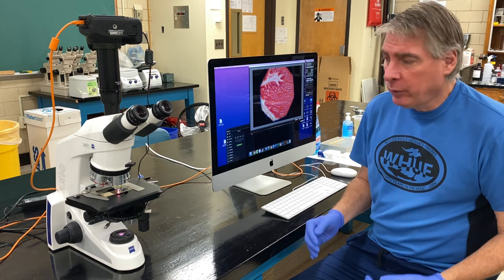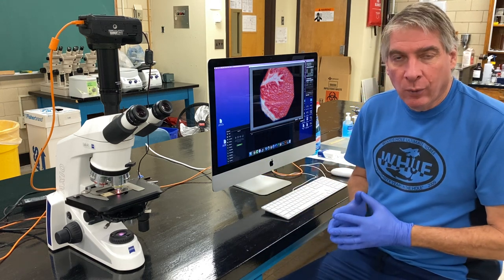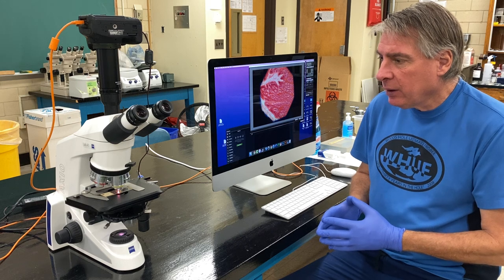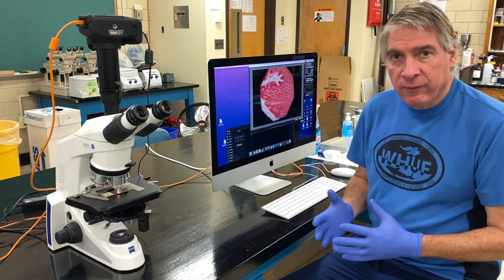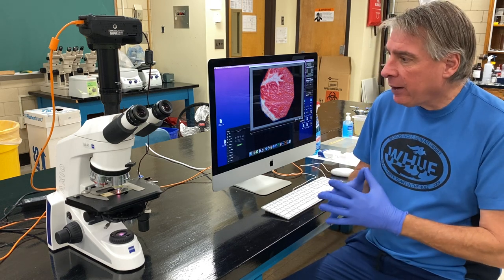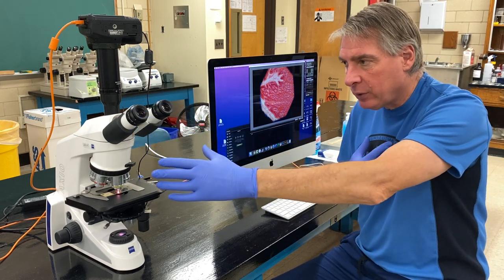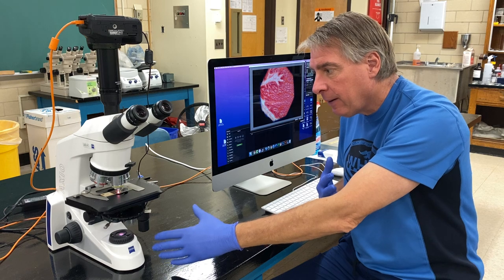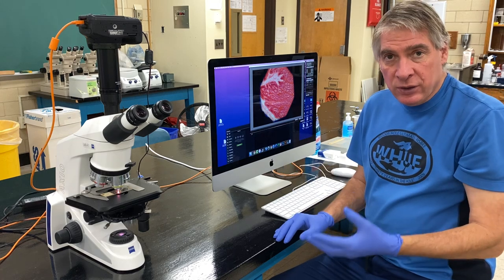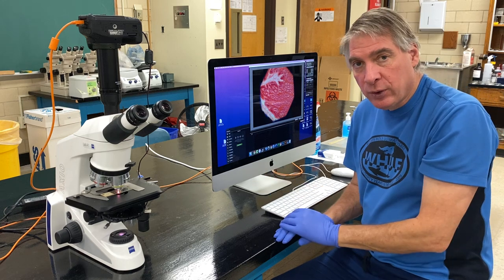Hey everyone, now that we're back at school and learning to use the microscopes, we've finished assignment one. Now I'd like you to try using bright field, dark field, and phase contrast on a given sample. When you start up, wear gloves, clean off the eyepieces, turn on the microscope, turn on the camera and computer, and load EOS Utility 2, making sure the camera is communicating with the computer.